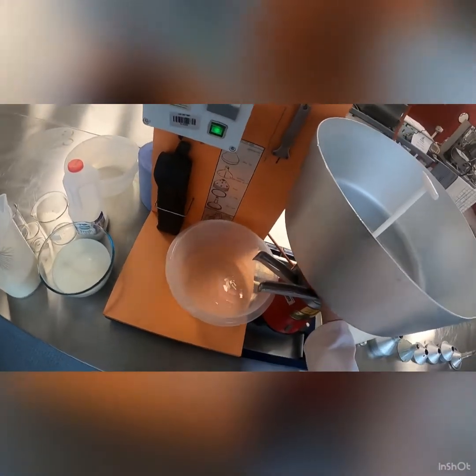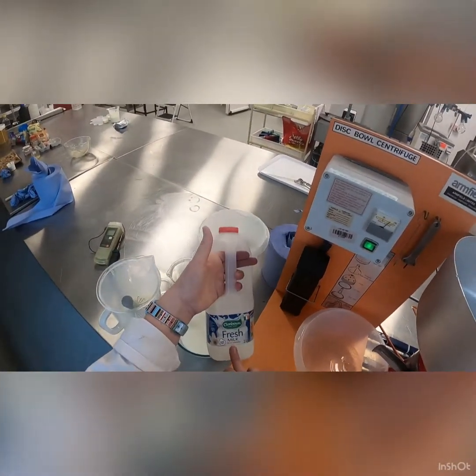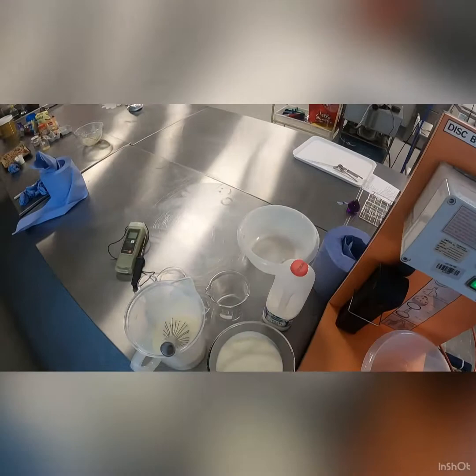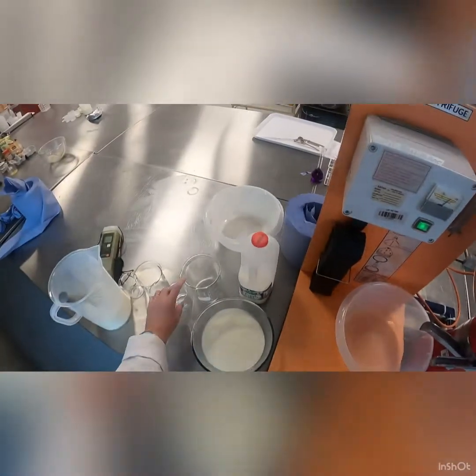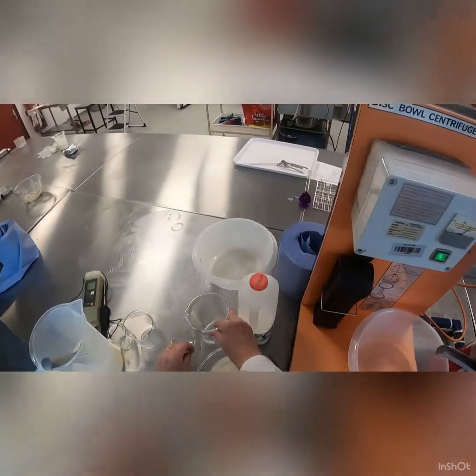I think we have the machine heated up now. We've got two samples to put through — the first one is a fresh milk sample and we've got one liter of that, already heated, because again you need to heat up your samples when you put them through the machine. I'm going to take this away and then we're going to have two pre-weighed beakers to catch our samples coming off.